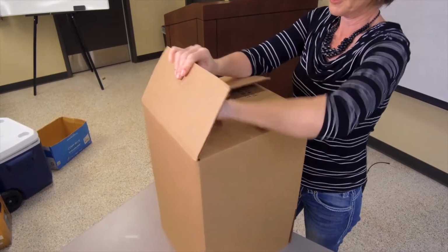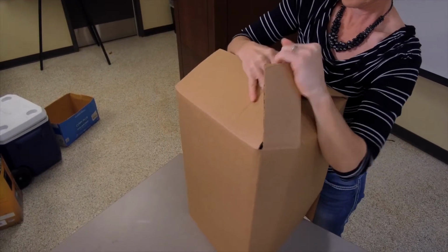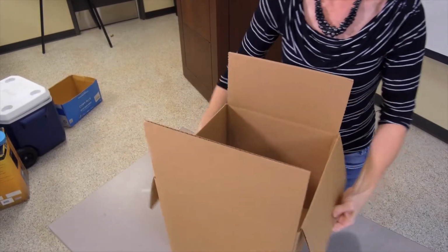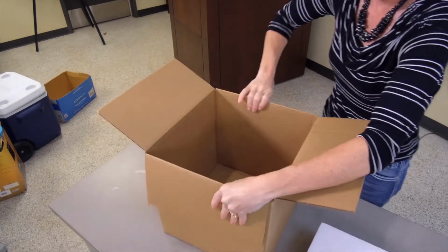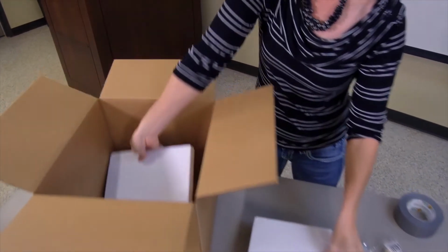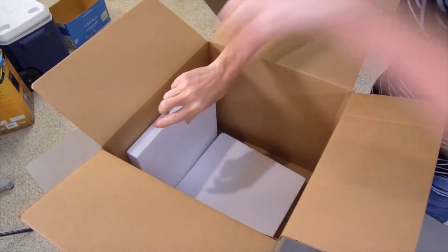We're going to fold our box up, just like a packing box. And then we're going to slip our pieces of styrofoam into our box to make our incubator.